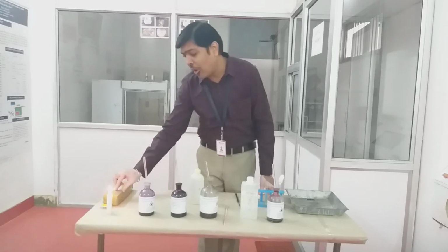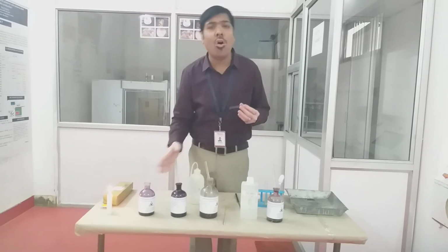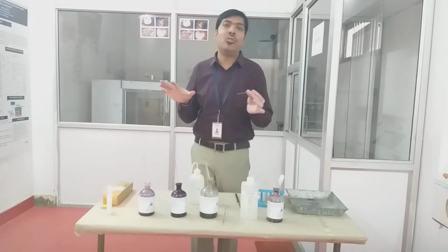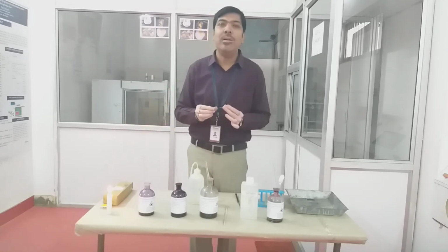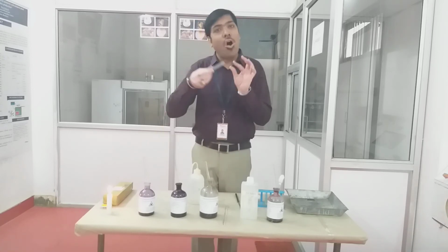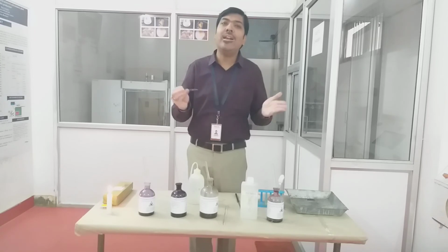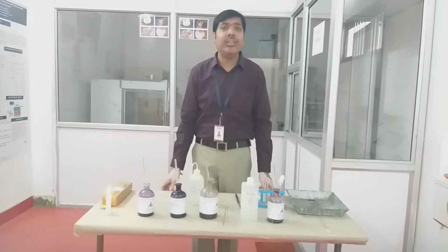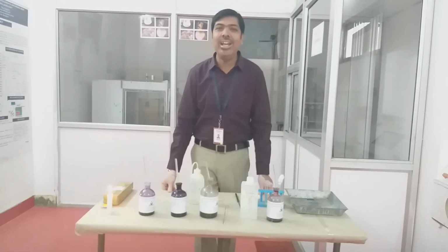Whereas in simple staining, for example if you are using methylene blue or crystal violet, all the microorganisms irrespective of their class will be visible in the same color as the dye. In the case of methylene blue, all the bacteria will be visualized as blue bacteria, and with simple staining we can also go for characterization and morphological differentiation of different classes of bacteria.